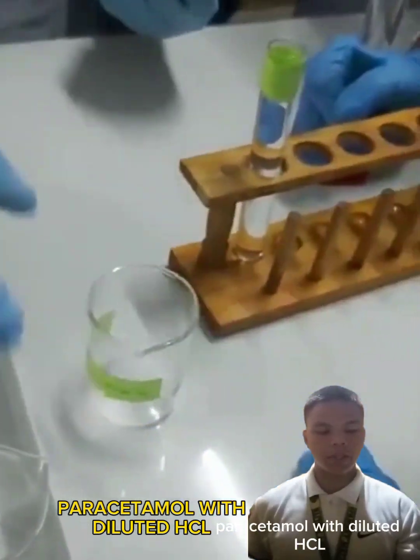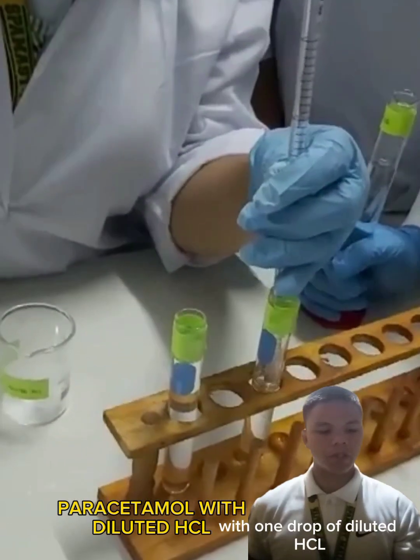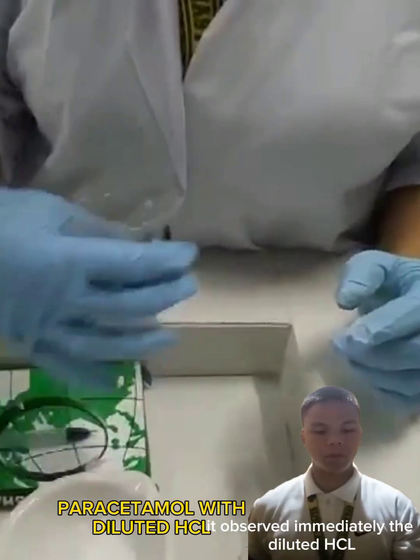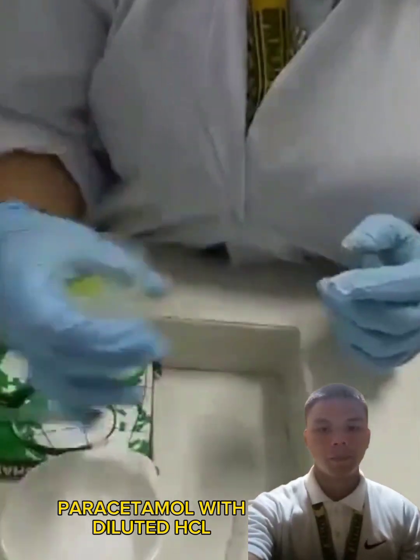Paracetamol with diluted HCl. 3 pieces of paracetamol with 1 drop of diluted HCl. The paracetamol powderized within 5 seconds. It absorbed the diluted HCl immediately, then it had no smell.